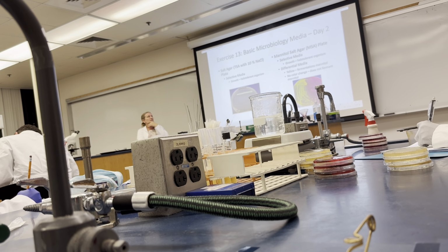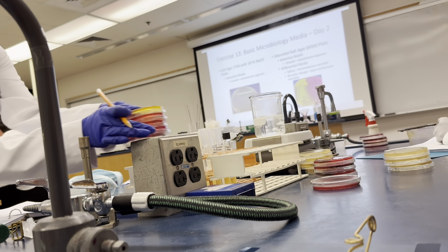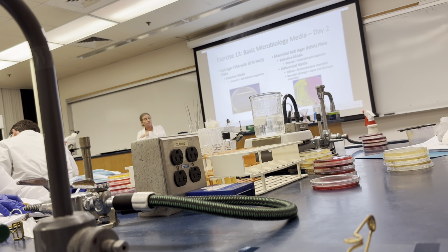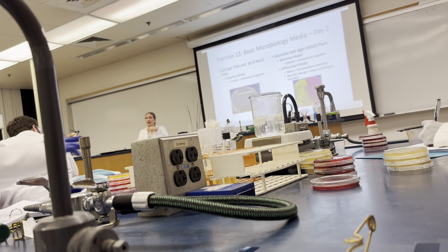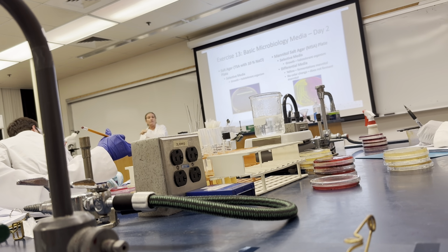From the other media. But this media also has a second component to it, and that's the differential media. We are looking for fermentation of mannitol. If you see yellow, that's the pH indicator, phenol red, turning from that red color to a yellow color because the environment has become acidic. So if you see yellow, that means the organism ferments mannitol. So the observation is yellow, the interpretation is it ferments mannitol. If you see no color change, so it's still pink in color, then it does not ferment mannitol.